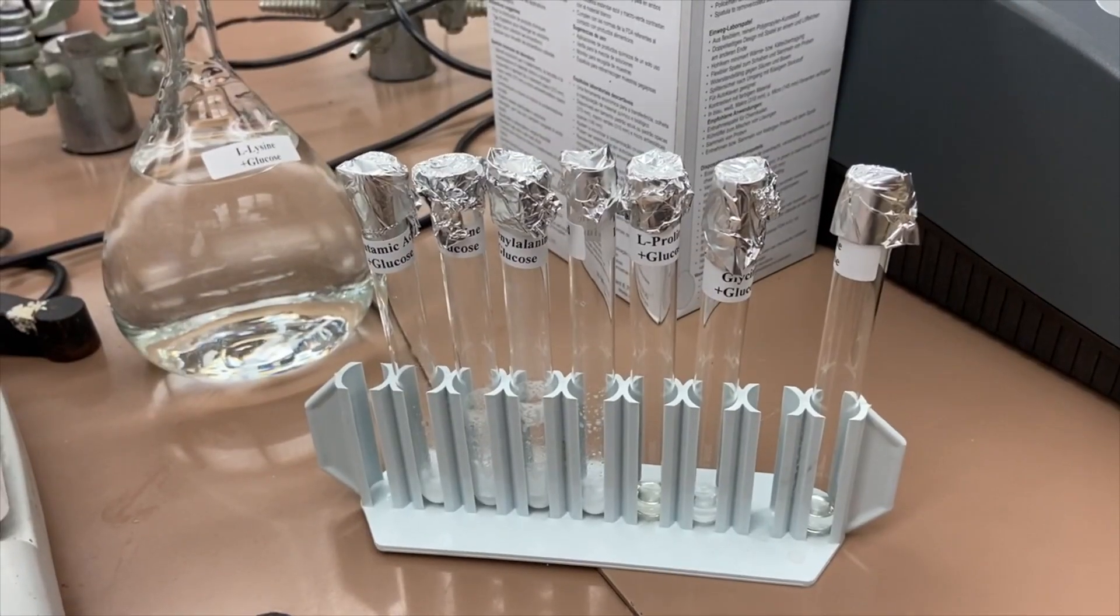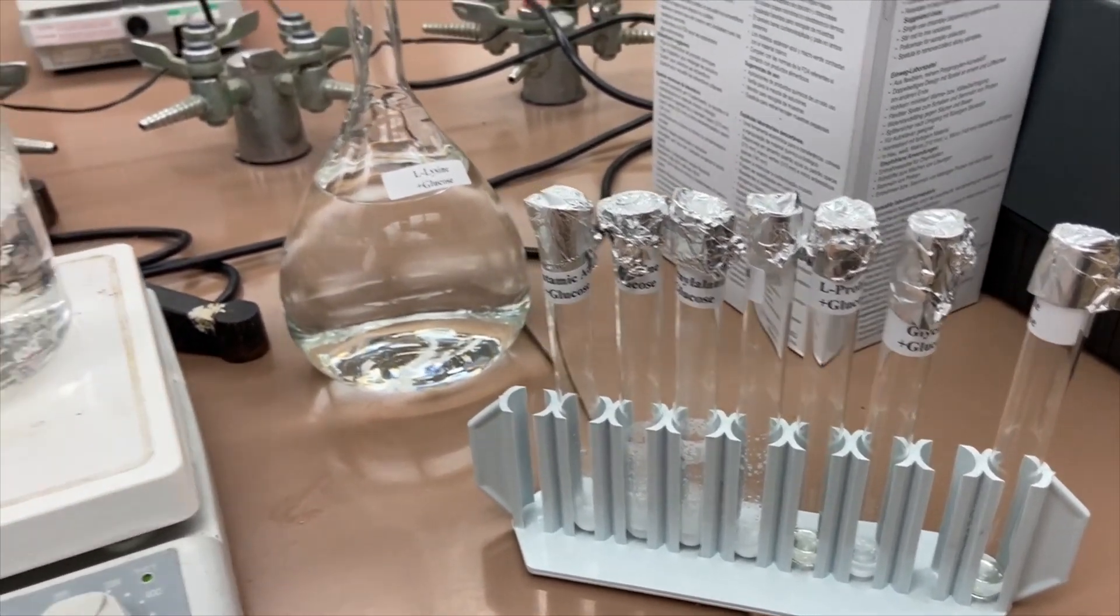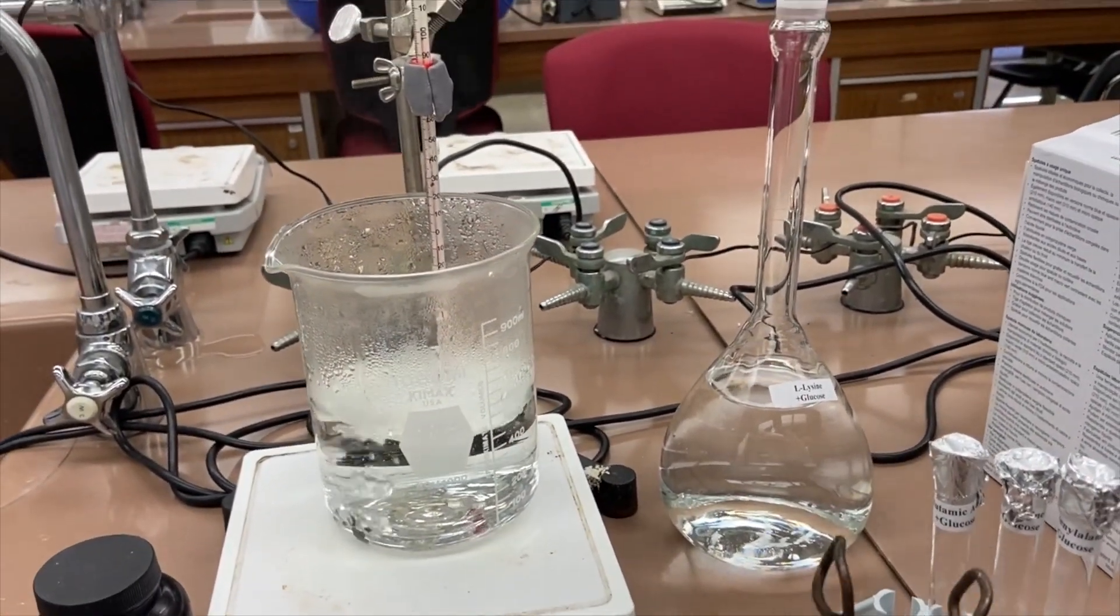I have my hot water bath ready at 100 Celsius and I added boiling chips. I'm going to place each test tube inside for 45 minutes.